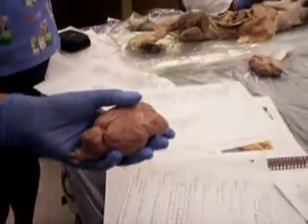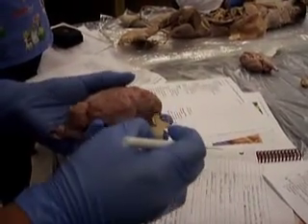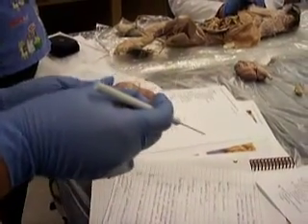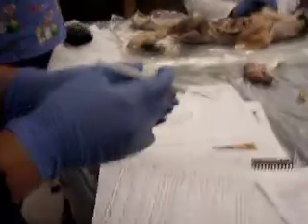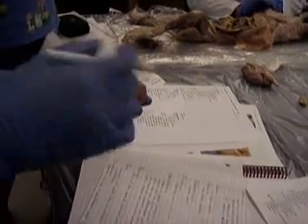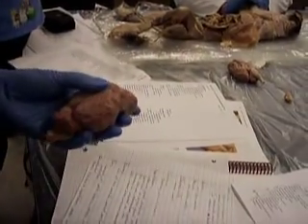So what do you do for pictures? Because we have the arachnoid space pictures. You can probably show the in between. Just on the bottom, right in between those two. Because you can't really see the arachnoid space. As soon as you peel this off, you break it. You break the arachnoid space off.